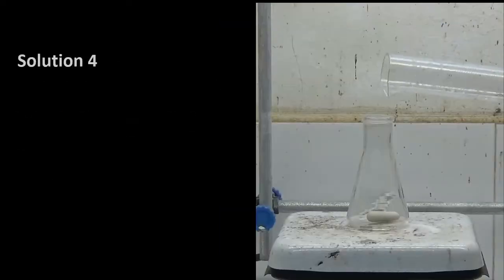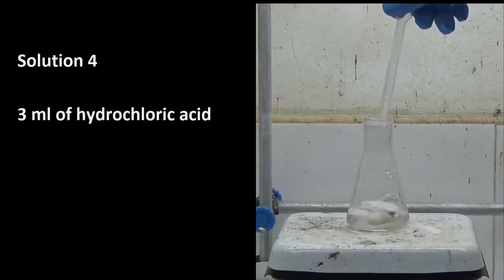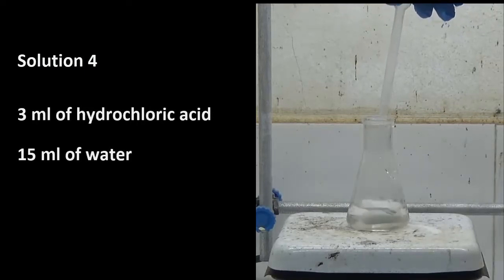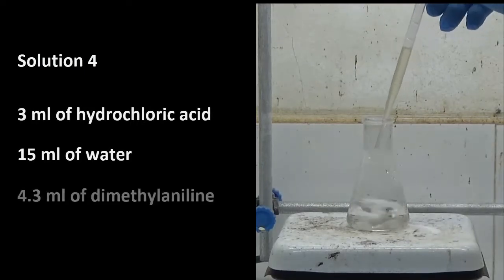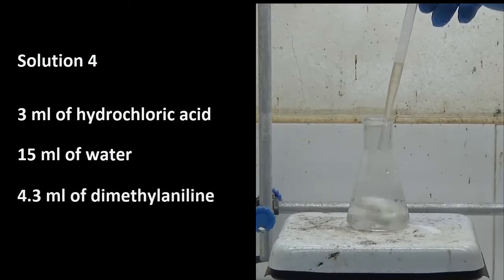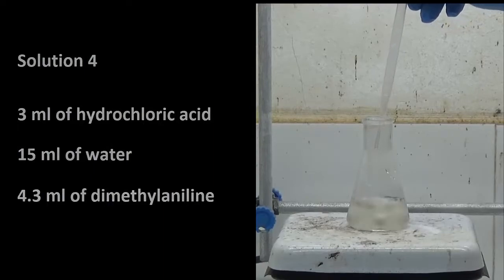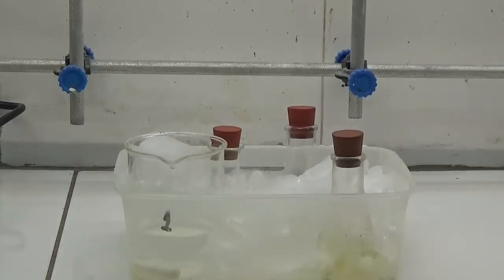Solution 4: Dilute 3 milliliters of hydrochloric acid in 15 milliliters of water and 4.3 milliliters of dimethylaniline. These solutions are cooled with an ice salt bath.